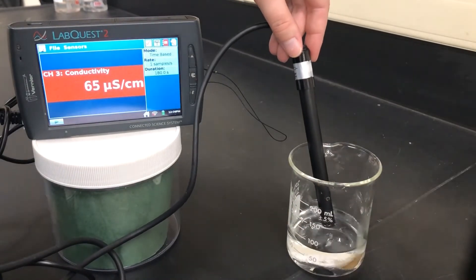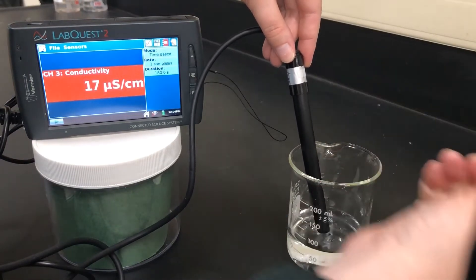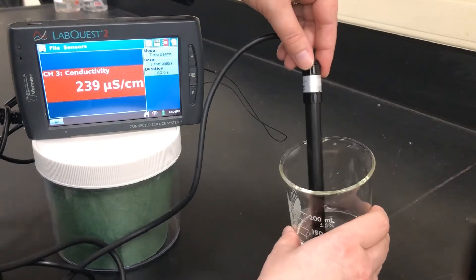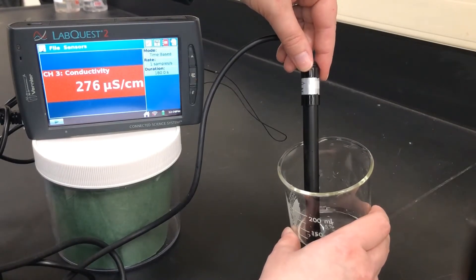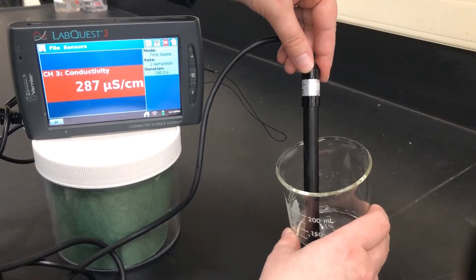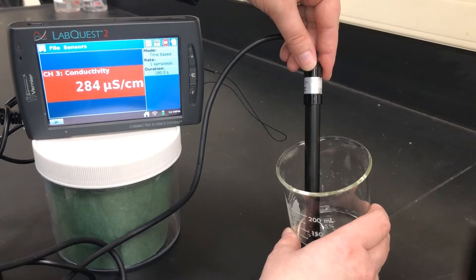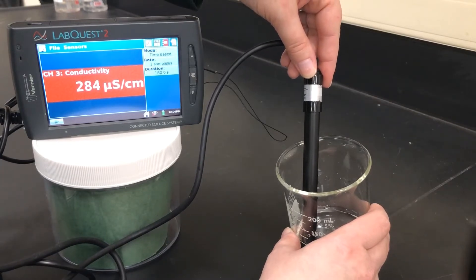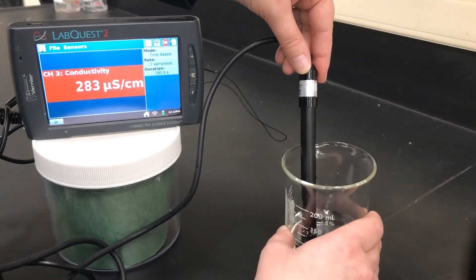Now we're going to add a second drop of zinc chloride. We gave it a swirl and we're going to let the number stabilize and then record. 284 for our second drop of zinc chloride.